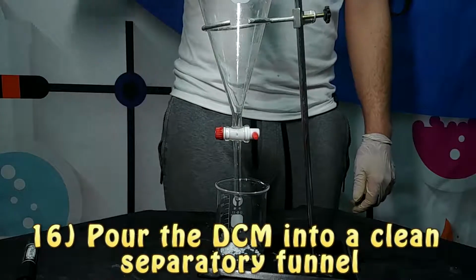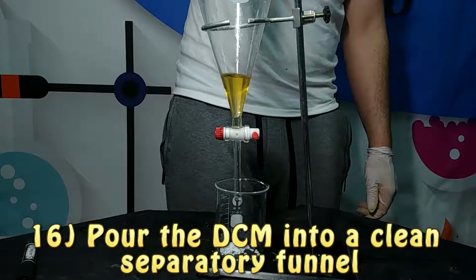So now we have arrived to our dehydration step, during which we are going to try to extract all the water from the dichloromethane. In order to do that, we are going to remove the black liquid in the separatory funnel, and we are going to wash it, of course. Then we are going to pour our dichloromethane in it.